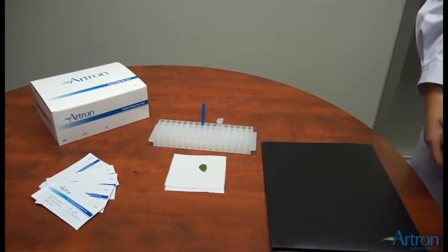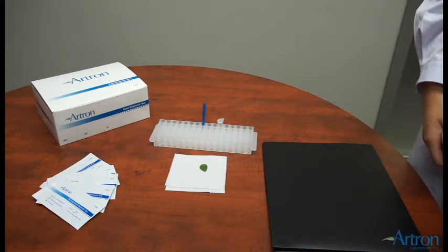Hello everyone, my name is Marisa and in today's video, I will be showing you the procedures of running an Artron CP4 GMO test.